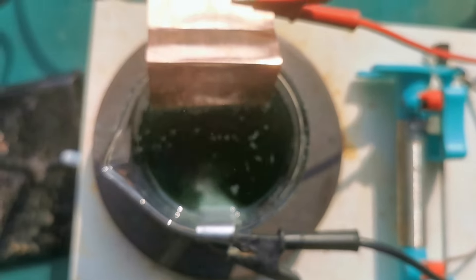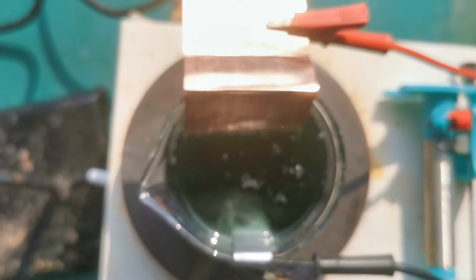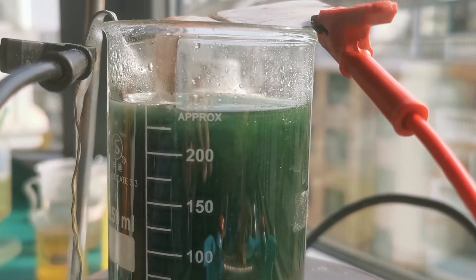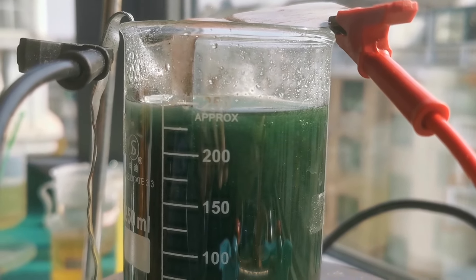But the current is already lower than a typical value for a nickel electroplating cell, so I decided not to change that. One of the benefits of the current is that it gradually warms up the bath and maintains it at our target temperature, 40 to 50 degrees Celsius.